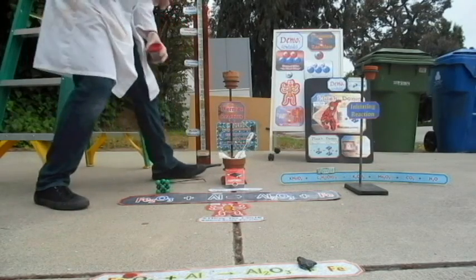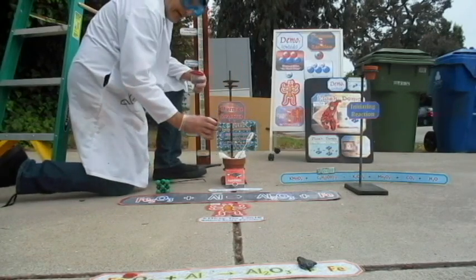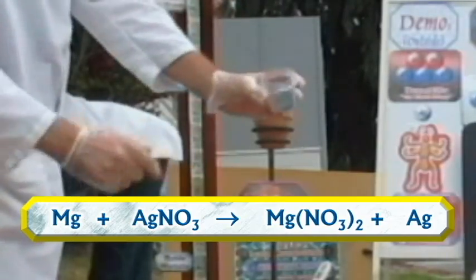Now I am making a little crater into the thermite materials, and I'm adding the materials for the flash demo. This is quite a bit. This is the magnesium, and the silver nitrate, as you see over there. Now when they're dry, they have no problem with each other. It's only when they get a little bit wet that they react. So I'm putting the flash demo right on top.